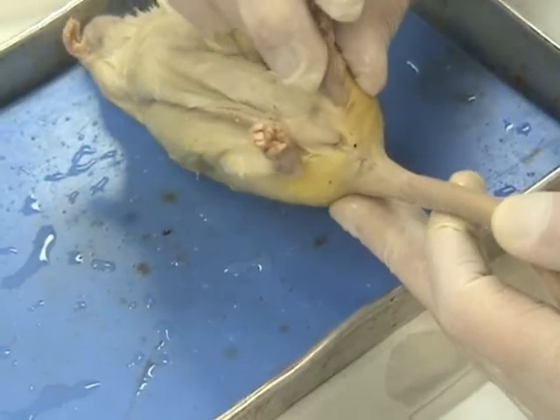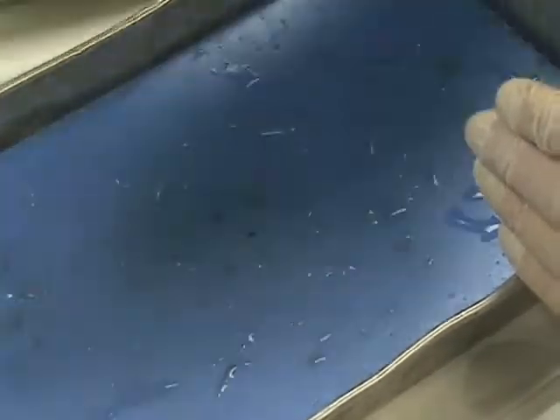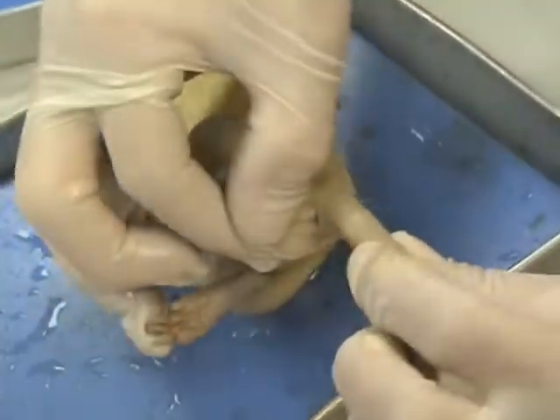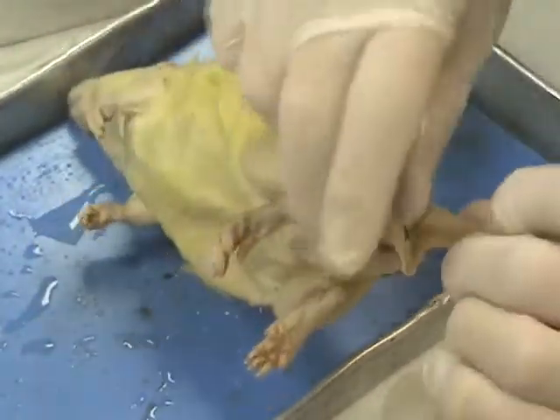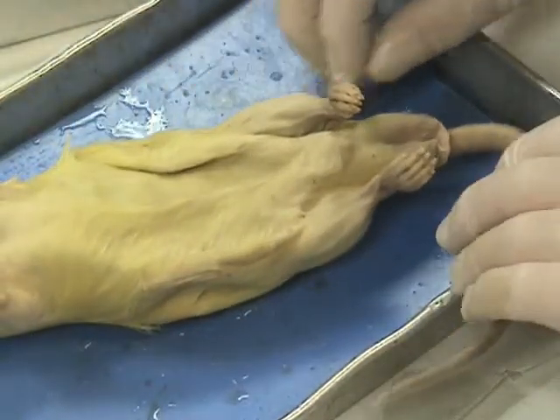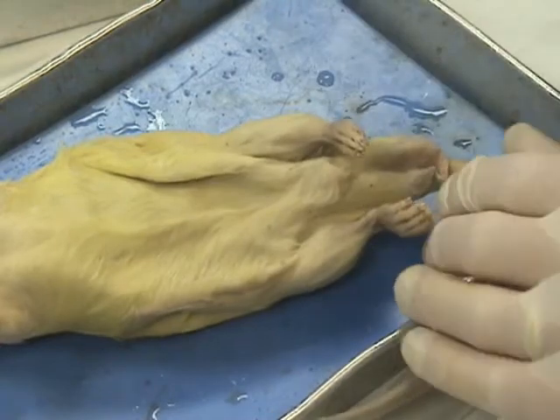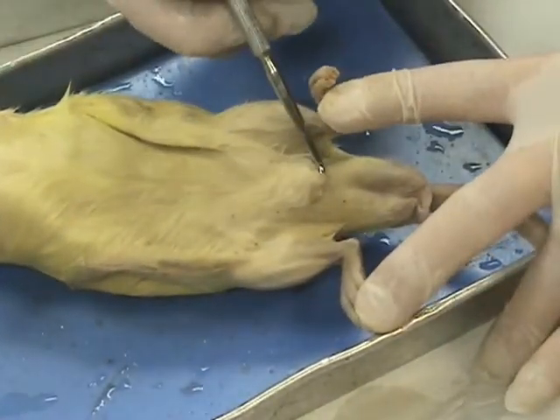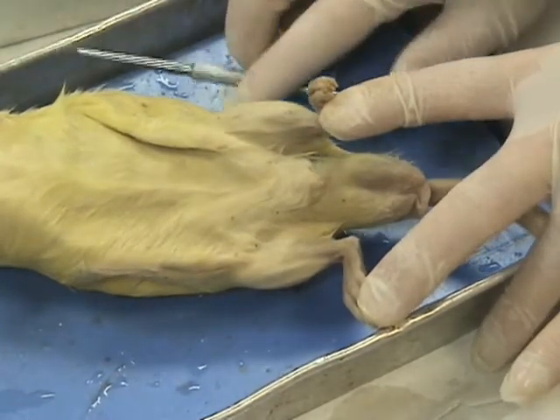In this case, I don't see testes, so this is probably not a male. This one over here, though, if we separate the tail back, pull back, we can find the anus, and if we go cranial to the anus, we do find a pair of testes, so indeed this is a male rat. In addition, we've got the testes. On the outside would be the scrotum, and if I pull these feet back a little bit, this right here would be the penis. So we have some structures here that are obviously specifically male.